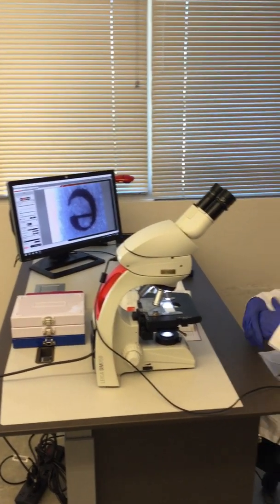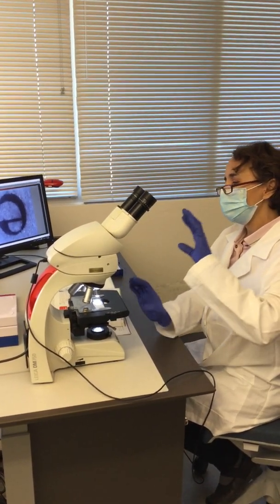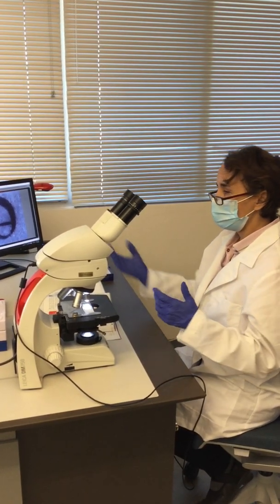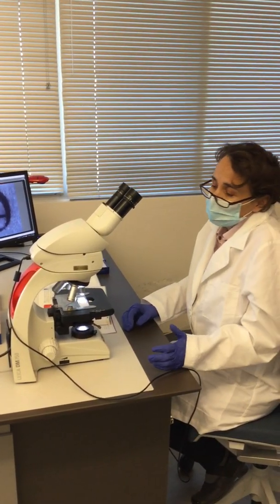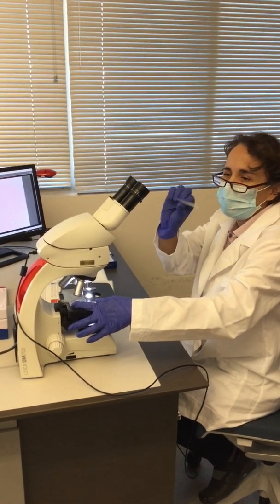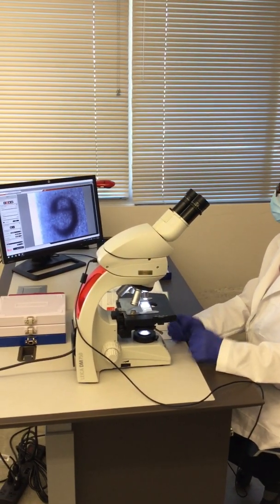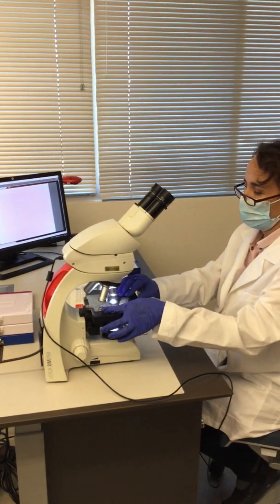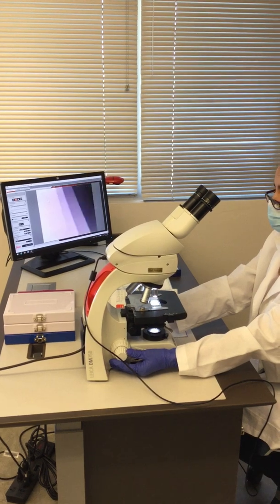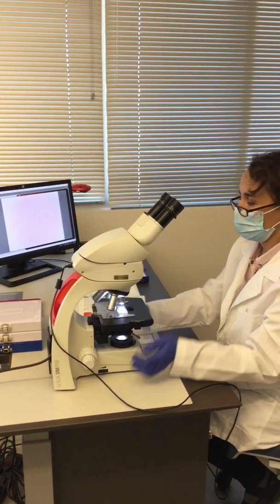Okay, it looks inverted, as I mentioned in the previous video, because of optics, how the light travels from one lens into another one without inverting it back. But that's how it looks, and it's okay. If you want it to look the right way, all you have to do is invert the E and then flip it so it looks the way it's supposed to. There are different ways that you can make it work if you want.